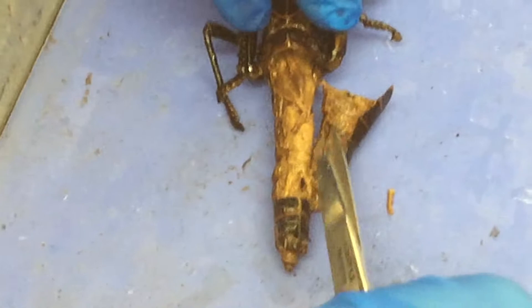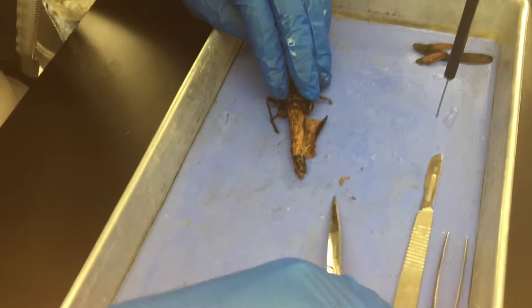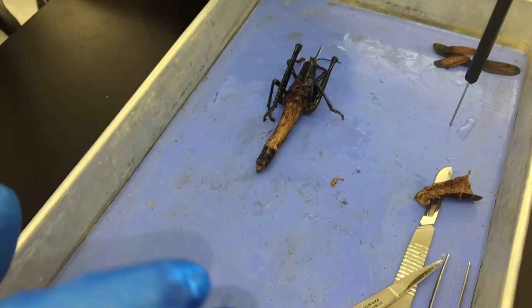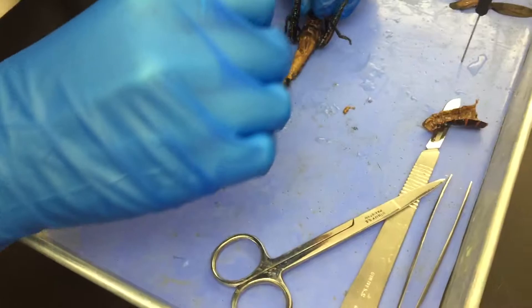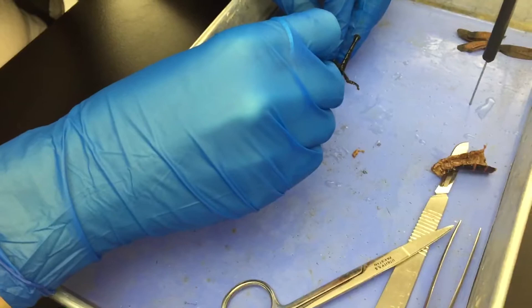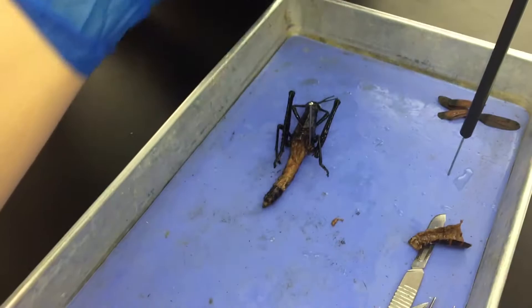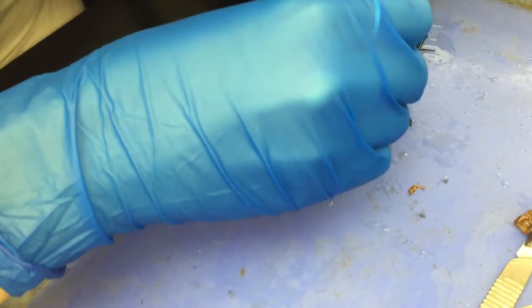All right, action — puncture this baby. Where am I puncturing him? Keeping him still — maybe right by his big legs. And then one on the anus. One on the anus? That's pager style. I could seriously just have him speak to me all day — his accent is wonderful.